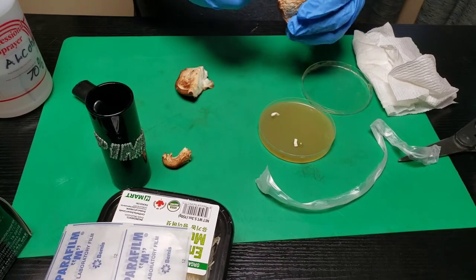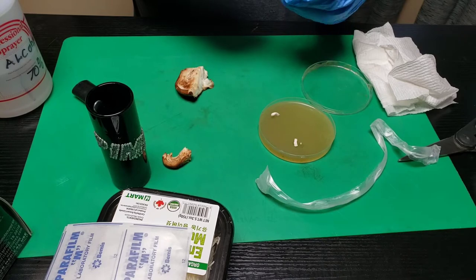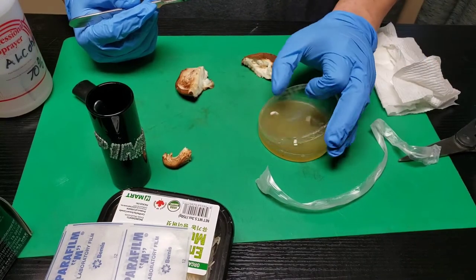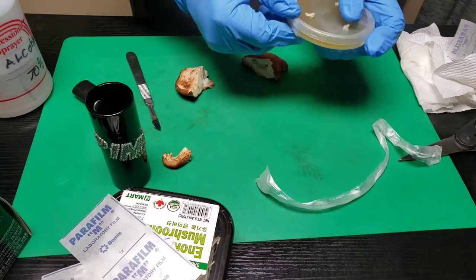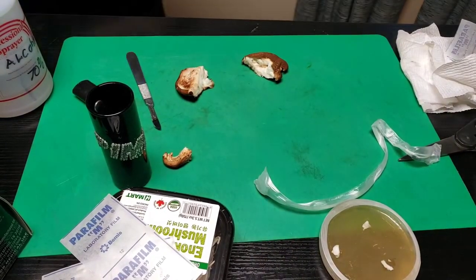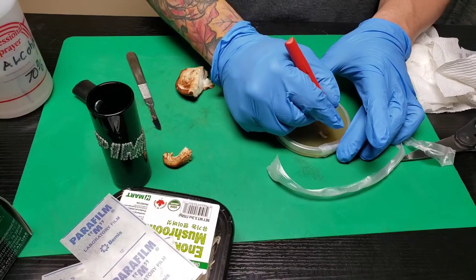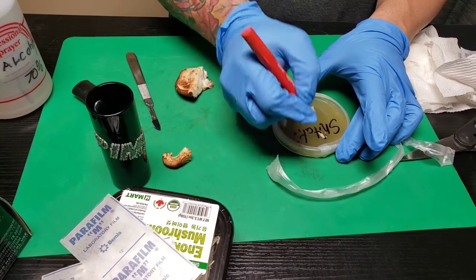There's another one — let me see if I can get another clean piece. Okay, right there, that's it. I'm going to close this up and don't forget to label it, because after a while you'll have no idea what's inside. So we're doing shiitake today, date is 3/16/2020.